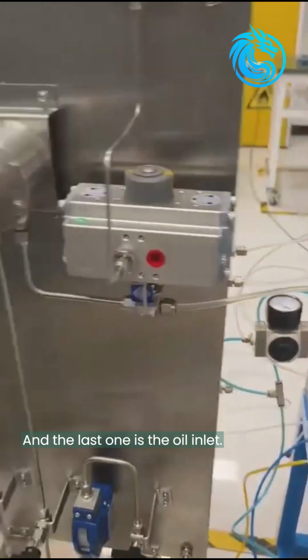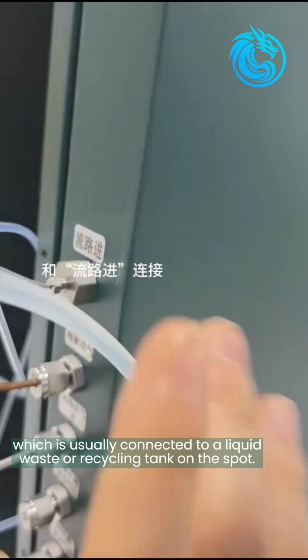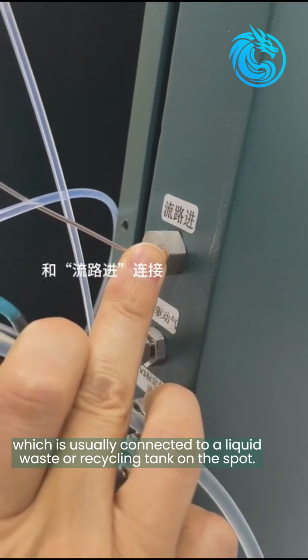And the last one is the oil inlet. This port is connected to the flow path inlet here. And another one is the liquid waste outlet, which is usually connected to a liquid waste or recycling tank on the spot.